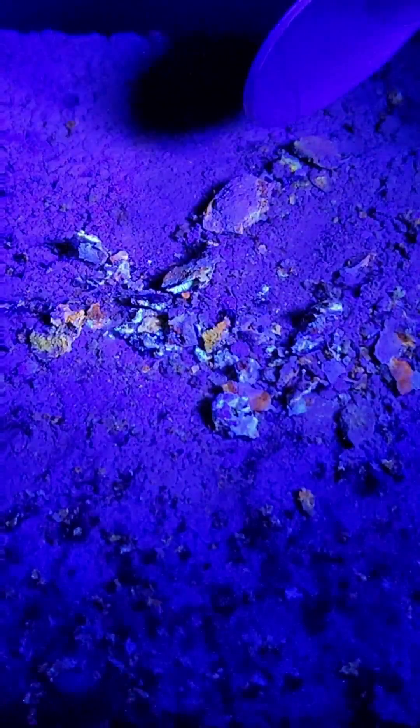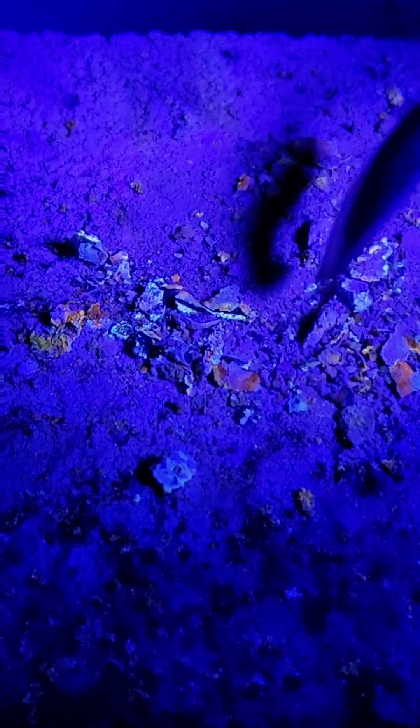Notice here that the phosphorescent material is actually a few different unique colors, including yellow, orange, and teal. This is due to metal impurities that were present on the block here and changed the color of the phosphorescence.